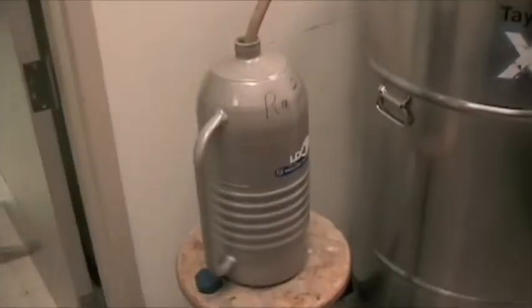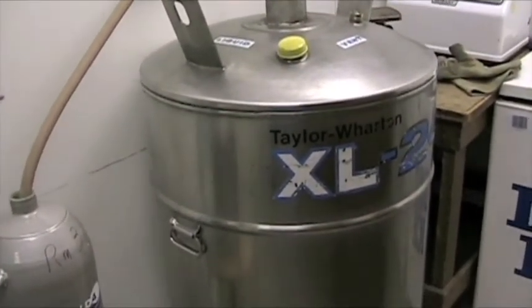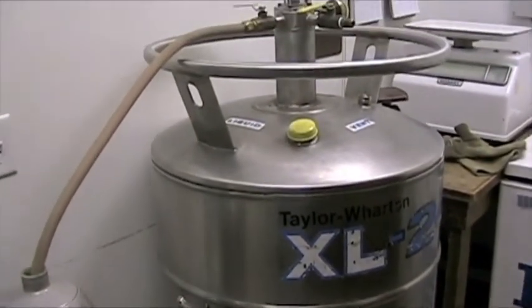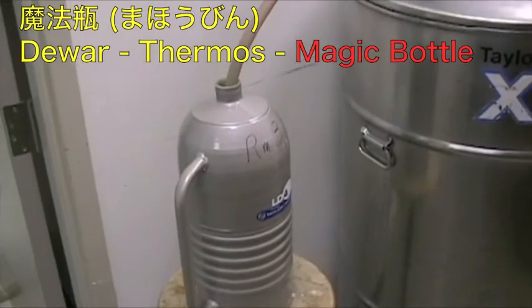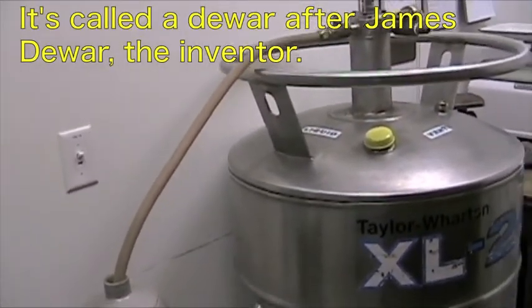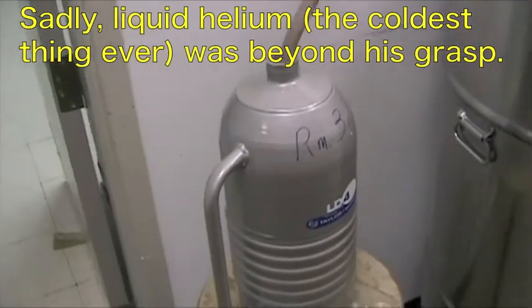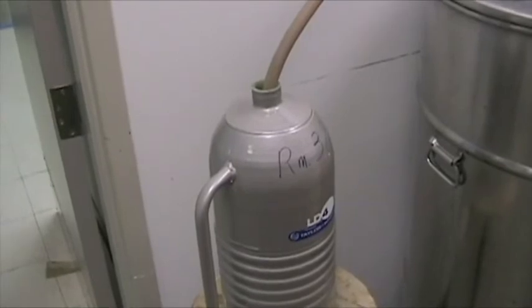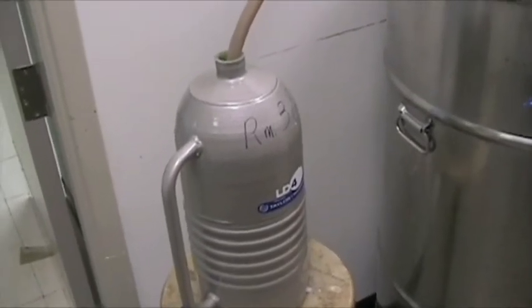I'll start off by going downstairs and getting some liquid nitrogen because I'll need that to protect the vacuum pump — we do that with liquid nitrogen. There is no pump here to pump the liquid out. What happens is the liquid nitrogen inside slowly turns to a gas, and the gas puts pressure on the vessel. We'll use that pressure to push the liquid out of the dewar into my dewar. This dewar hasn't had liquid nitrogen in it for a while, so it's at room temperature. As soon as I start putting liquid nitrogen into it, it's going to cool the vessel, but it's immediately going to turn that liquid nitrogen into gas and shoot it out until the inside of the dewar gets cooled enough for the liquid to stay.